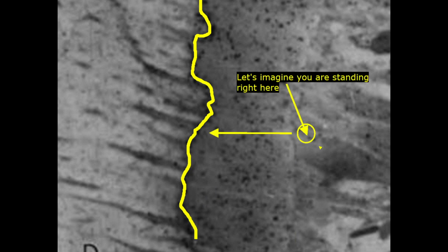What complicates the picture is the predentin area, because that area is partially mineralized and contains not only collagen forming the substructure of the tubule, but also a host of non-collagenous proteins that actually control the mineralization process itself. It is this area that creates the confusing SEM picture.